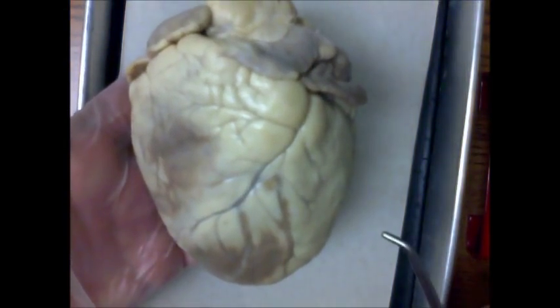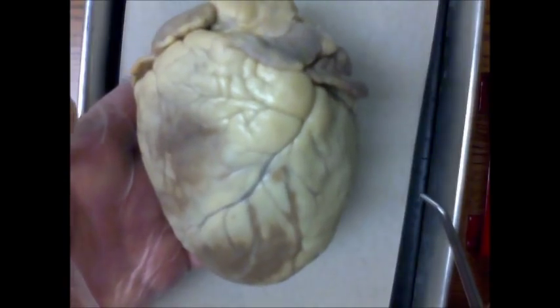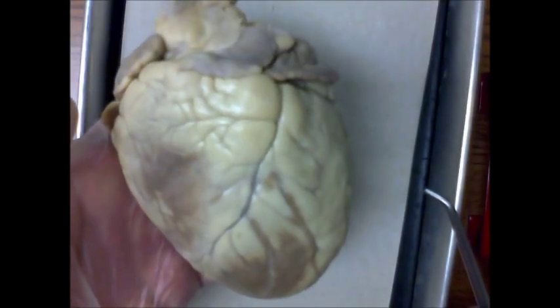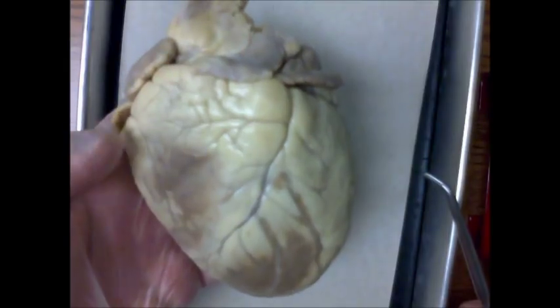In this video I'm going to go over some of the basic structures of the heart. This is a sheep heart, shown here in an anterior view.